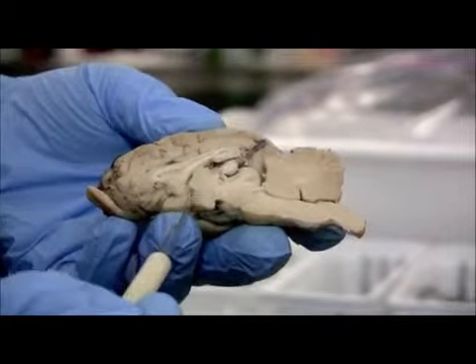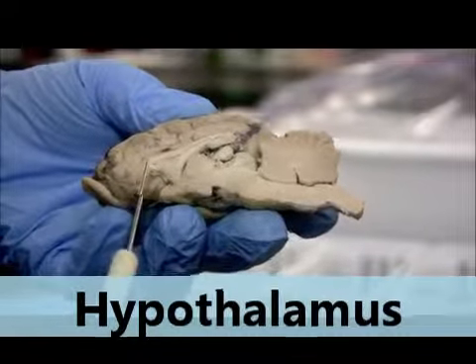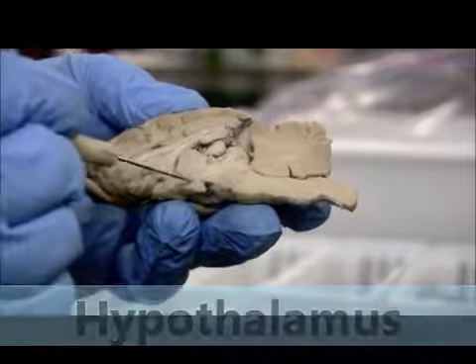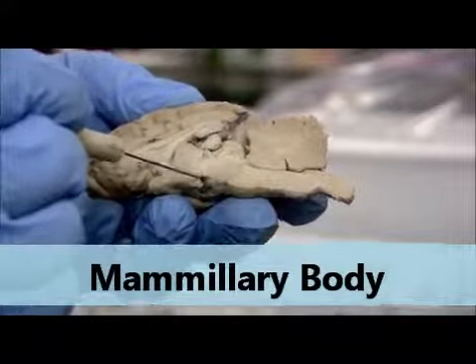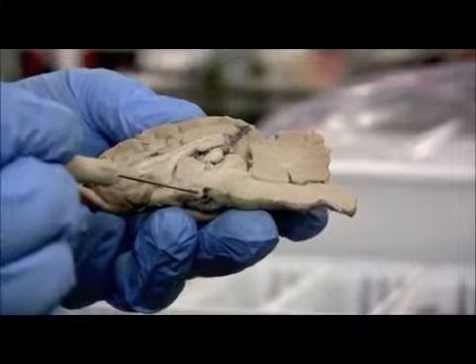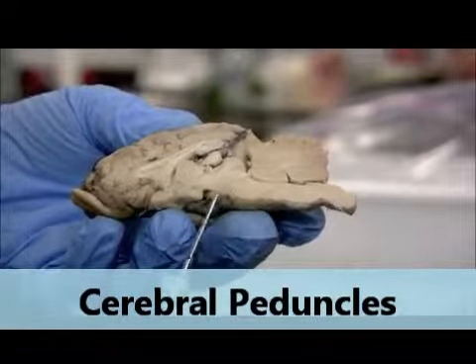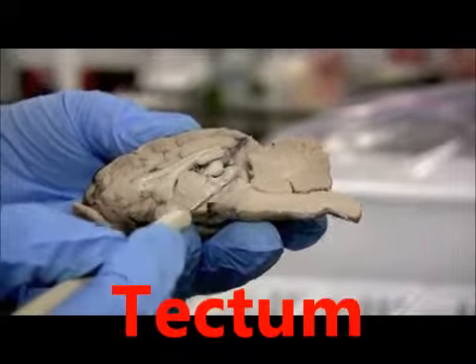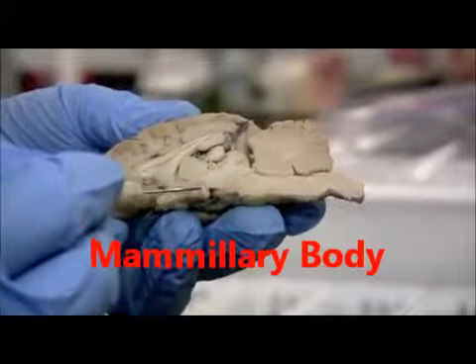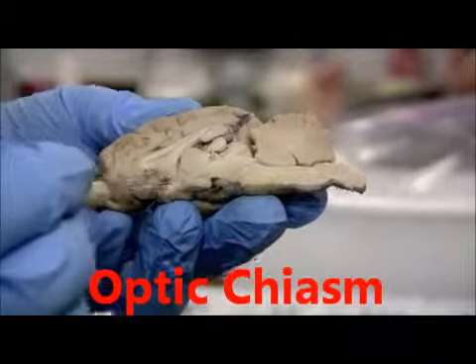And if this round circle is the thalamus, then below it is the hypothalamus. Right? So this region between the mammillary body, which I haven't mentioned in this view yet, this round structure is the mammillary body. And these are the cerebral peduncles, the footpaths that we've cut through coming from the pons. So it's right on the other side of the colliculi. These are the cerebral peduncles, mammillary body, and then the hypothalamus. This is the optic chiasm that was cut through.